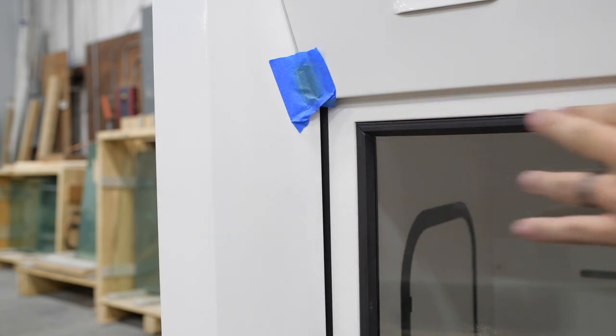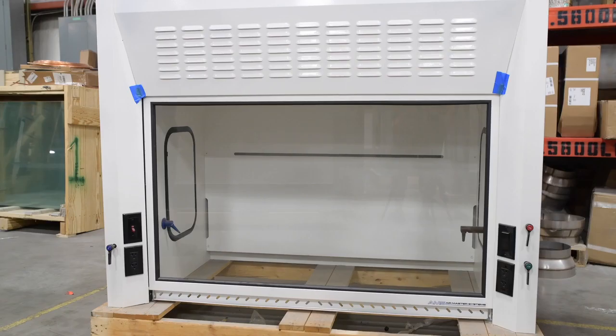Just seat the seams together and click them into place. Now you have completed the sash replacement.